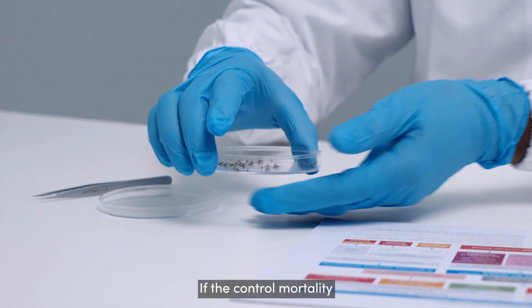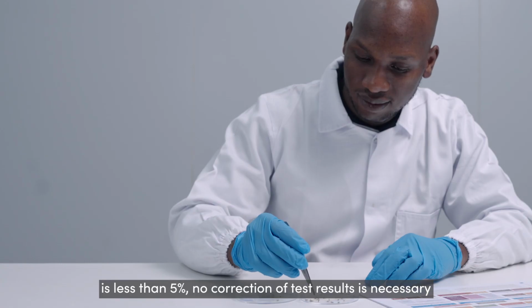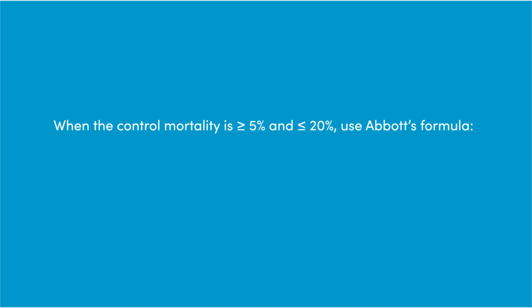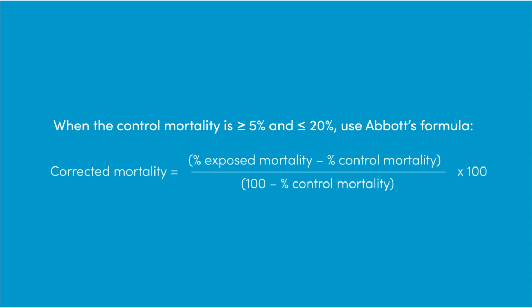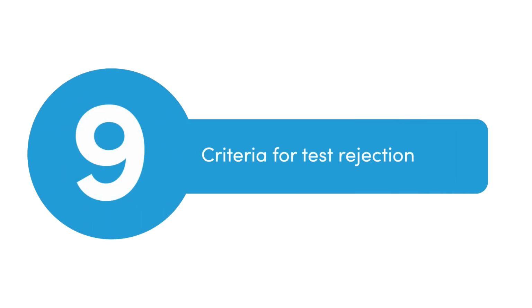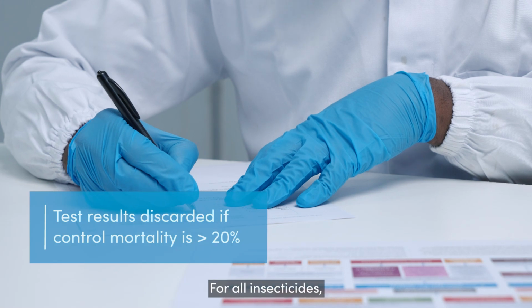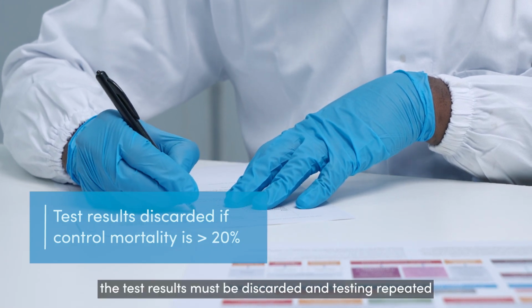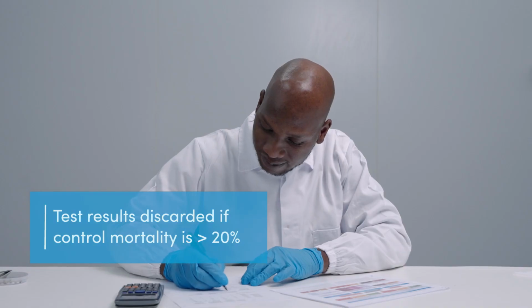If the control mortality is less than 5%, no correction of test results is necessary. When the control mortality is between 5% and 20%, the test mortality should be corrected with the control mortality using Abbott's formula. For all insecticides, the test results must be discarded and testing repeated if the control mortality is greater than 20%.